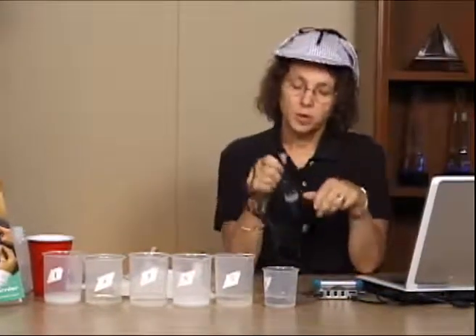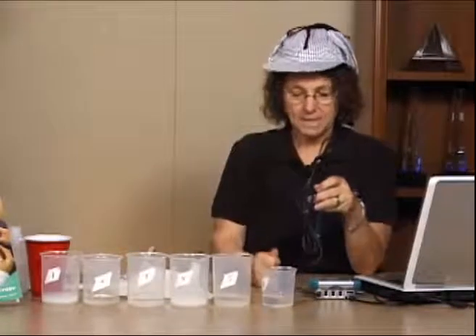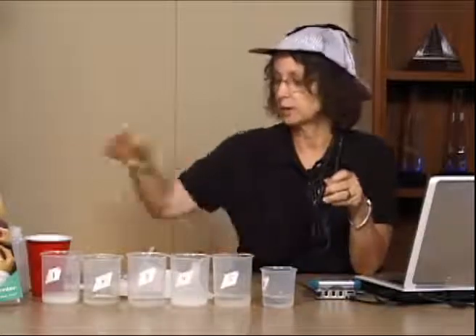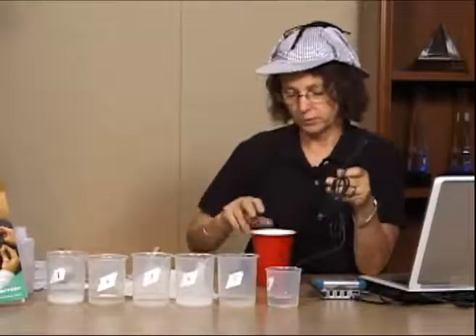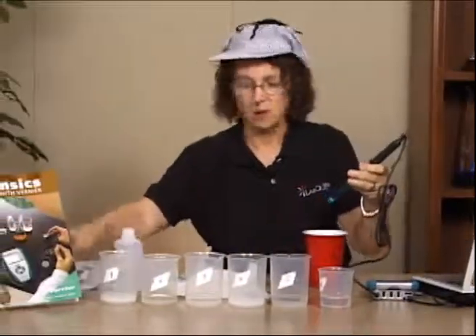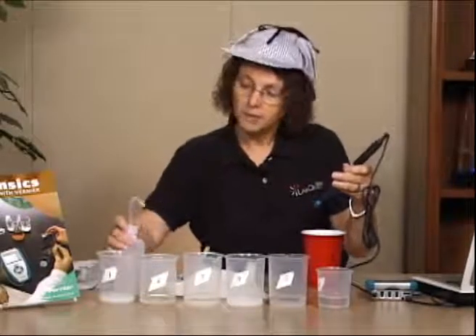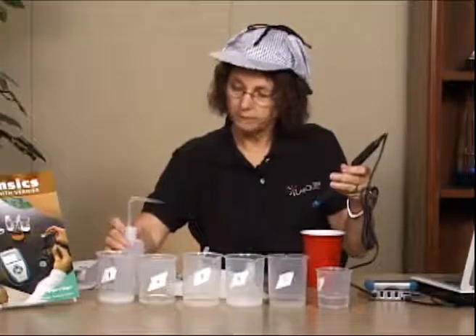And when they went to put the probe back in, they kind of banged it down to get it into the bottle, and then they broke the tip of my pH probe. So you need to be a little bit careful that you don't allow your students to do that. So just by moving the cover up, we solve that problem. The pH probe is already calibrated. I don't have to worry about that.